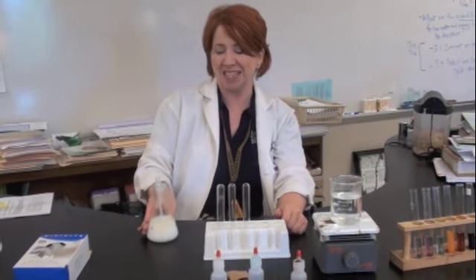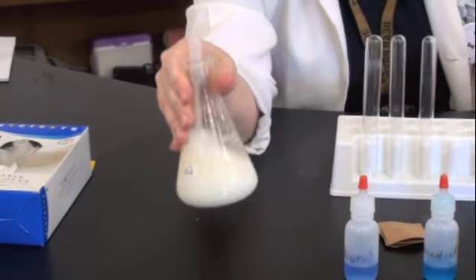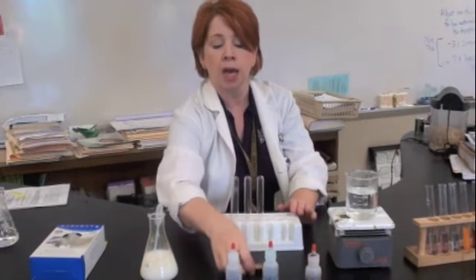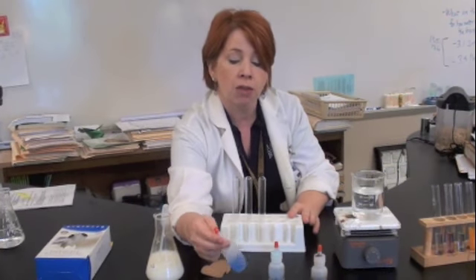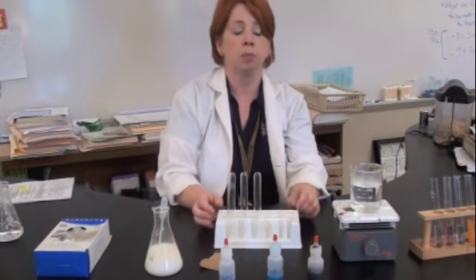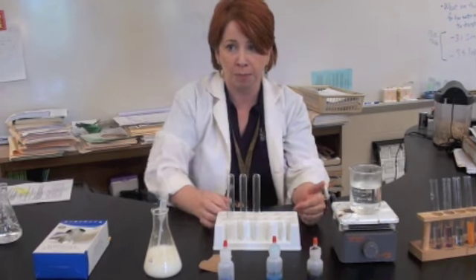So what we're going to do for you today, Stu, is we're going to test this unknown. It contains 1 or more of the biomolecules that we have been working on. What we need for that is some test tubes, the paper for the fat test, and our reagents, the Biuret, the Benedict's, and the iodine. But before then, and the boiling water. Before then, what we need is to put on the personal protective equipment.